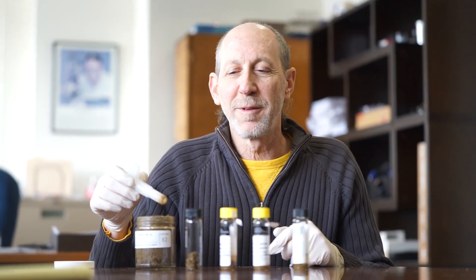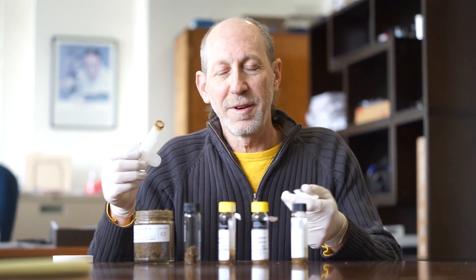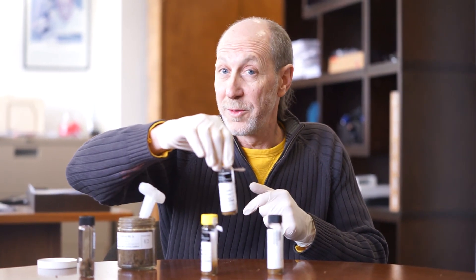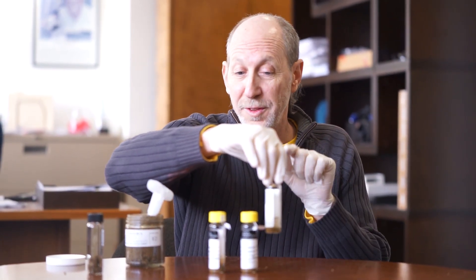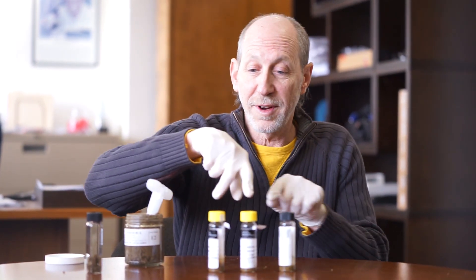Once you've filled all four vials, you dispose of your plastic TerraCore handle and move on to the next sample. You have two DI vials with a stir bar — one is for the initial analysis, one is for a rerun if we have to rerun the sample. The third vial with the methanol is if we have to do a dilution. This is a medium level sample preparation in the field so that these vials never have to be opened. If you have any questions regarding this, feel free to email clientservices@yorklab.com and we'll be happy to help you out.